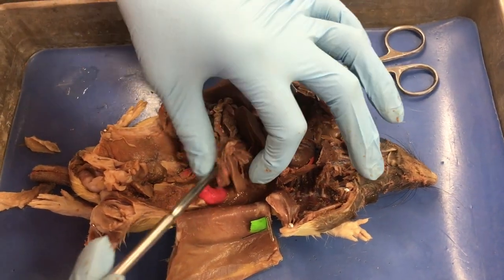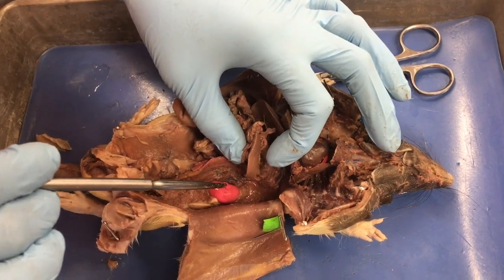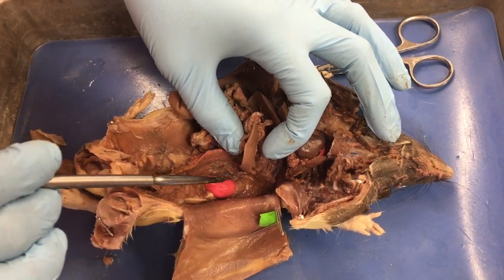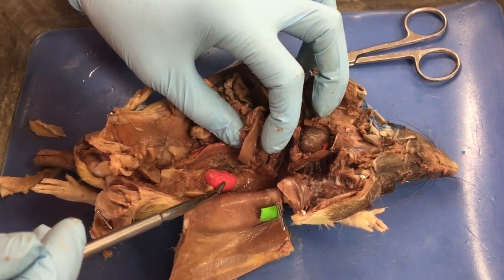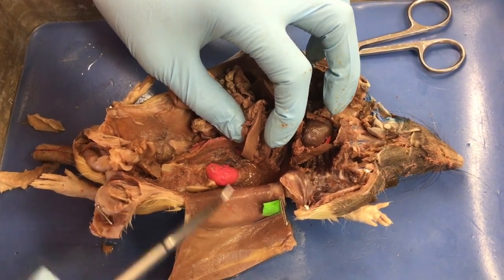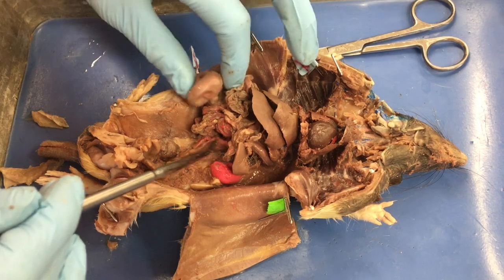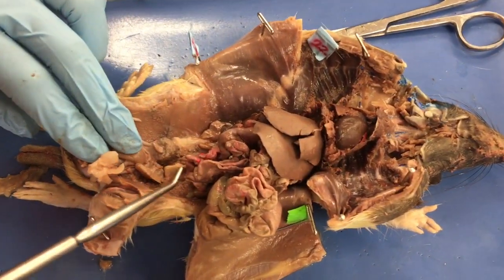He's got his little spleen there. He's got his kidney, and the color of the kidney, remember, in a normal body, it wouldn't be a red or a blue color. That's just because we inject them with dye, and that's up here where we inject them with dye right before they die, to make sure the veins and arteries get colored. Veins are blue, arteries are red, and then we go down to this guy's reproductive structures.